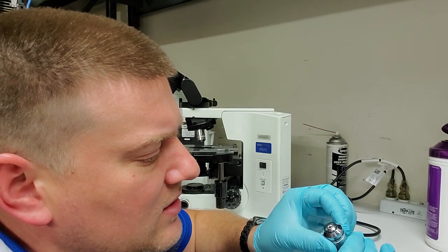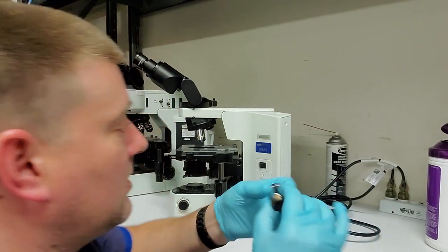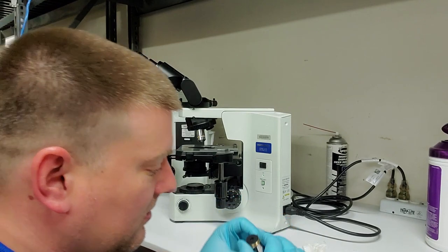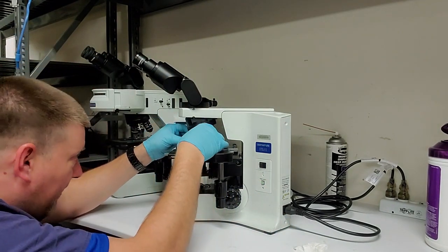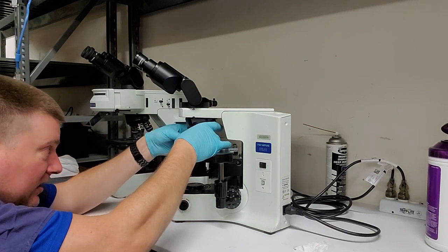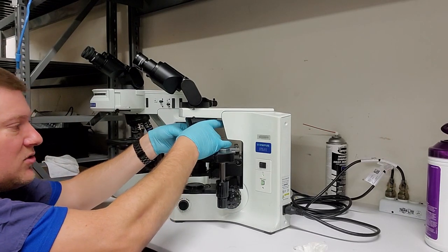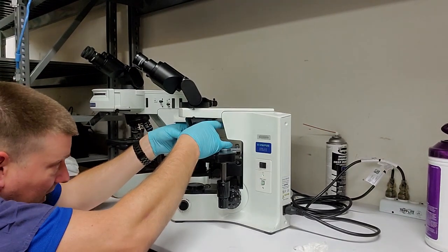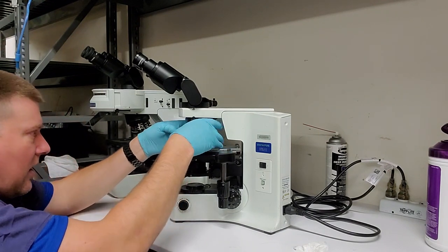So that's what I did, is I gave it a really good scrub. I'm taking a look for any chips. Looks like it's very clean. Backside's nice and clean. It goes exactly back where I found it. Be careful now that the opening is nice and clean. Don't drag it on anything. Don't damage it. Jeez. Okay, there we go.